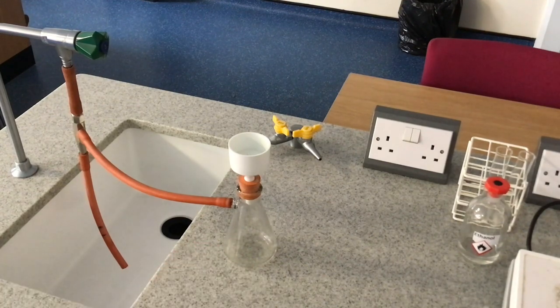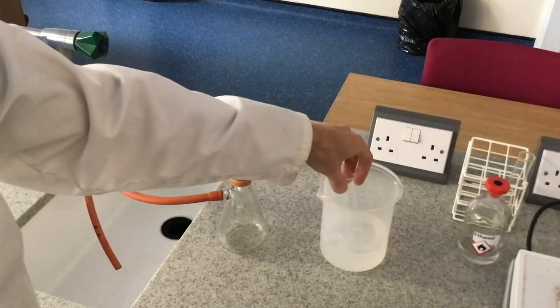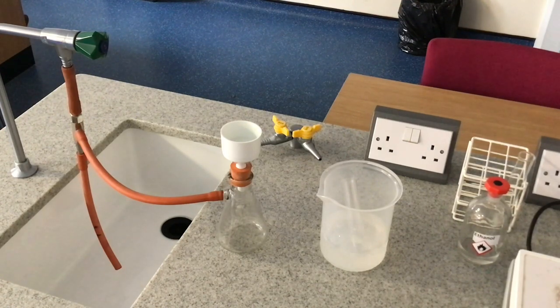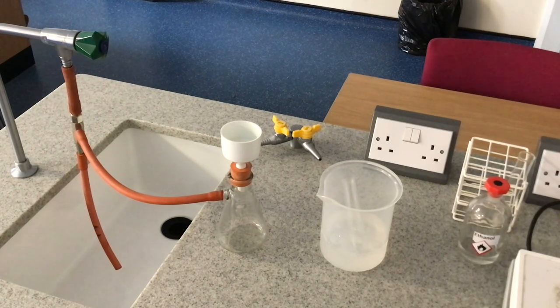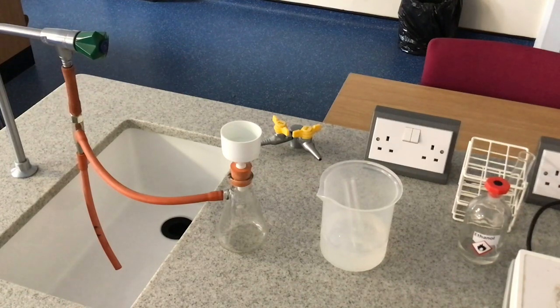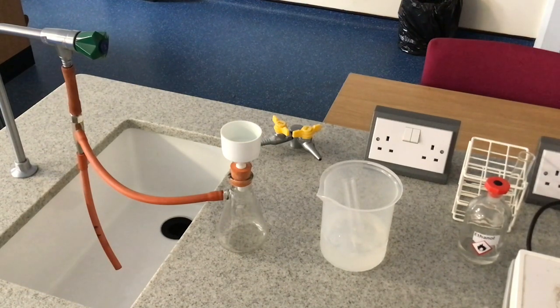I'm going to transfer the filtrate to a boiling tube, then cool it down by putting it in a beaker of ice water for a few minutes to recrystallise the aspirin. Now I'll explain why the minimum volume of hot solvent was used. We dissolved the aspirin in a minimum volume of hot solvent to achieve what's called a saturated solution — a solution holding its maximum amount of solute. The benefit is that as soon as you start to cool it down, the crystals form more readily.